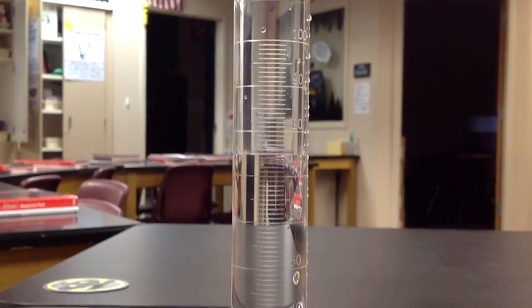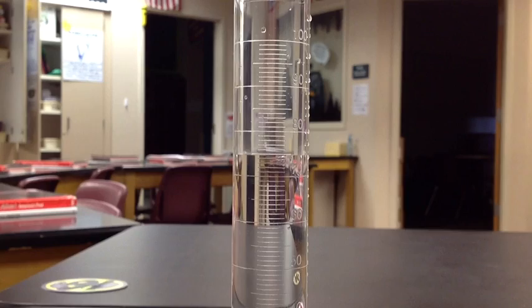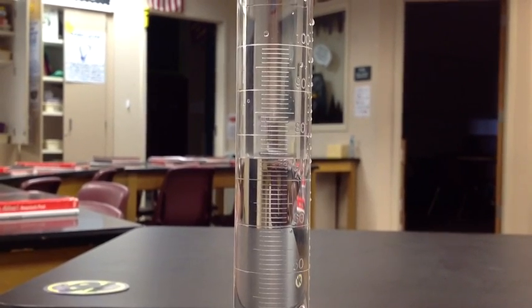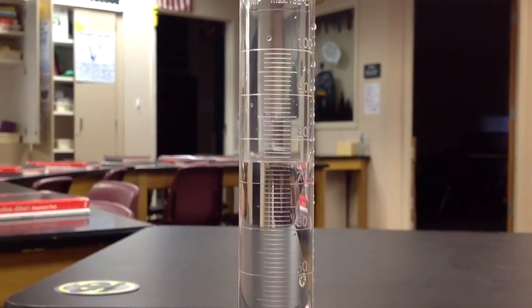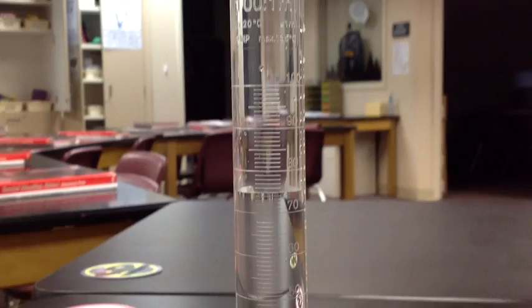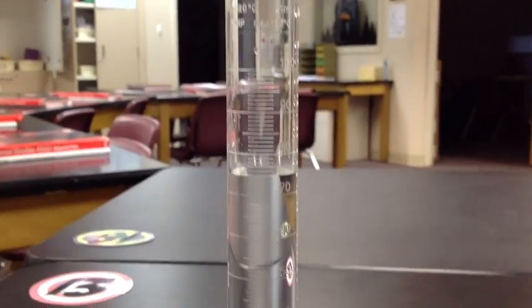Okay. If you notice, I'm right at 75 milliliters of water. Now I write that down because that's my beginning volume of water.